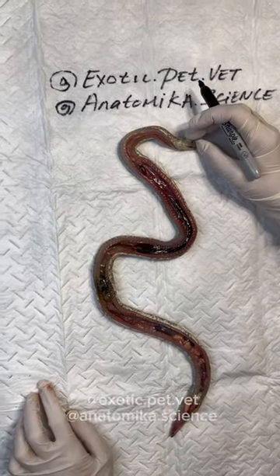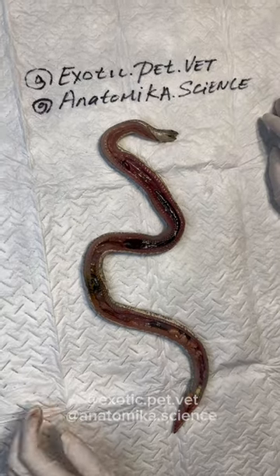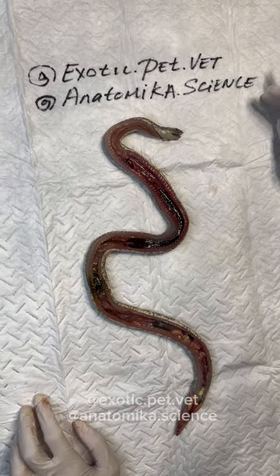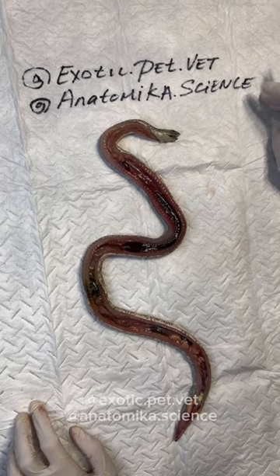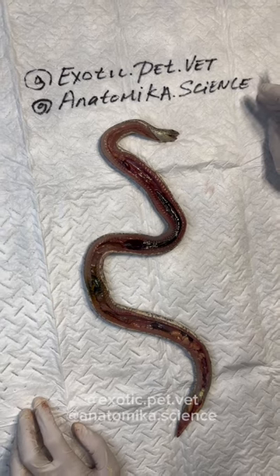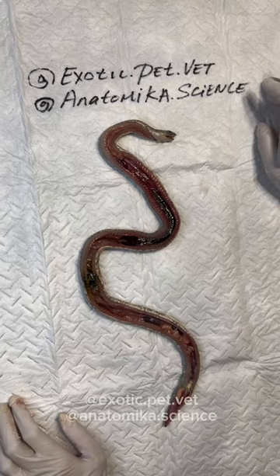In this video we will label the organs of a snake. We've got a snake necropsied here — she was donated from a breeder and she is a young female Kenyan Sand Boa. We opened her up and there are some issues here and there, but nothing that jumps out as super distinct.